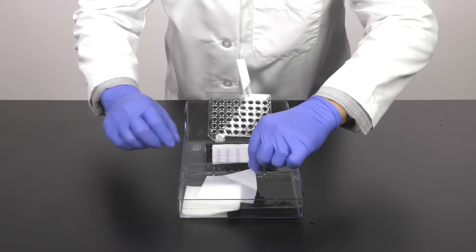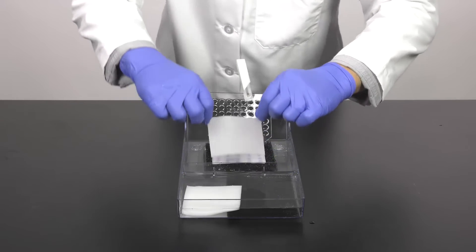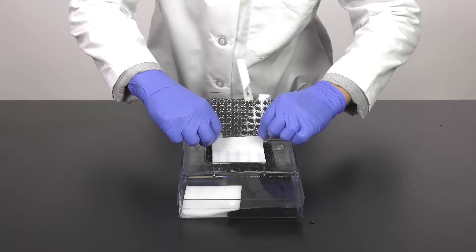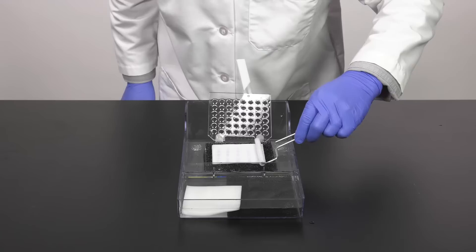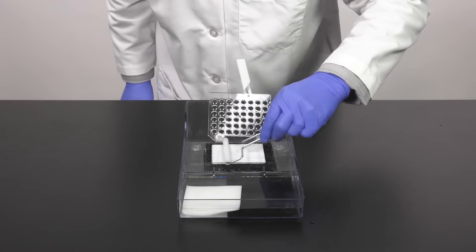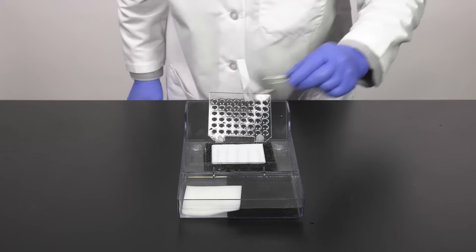Now place your pre-soaked membrane onto the gel. Using a roller, remove any air bubbles between the gel and the membrane to ensure maximum and even protein transfer.